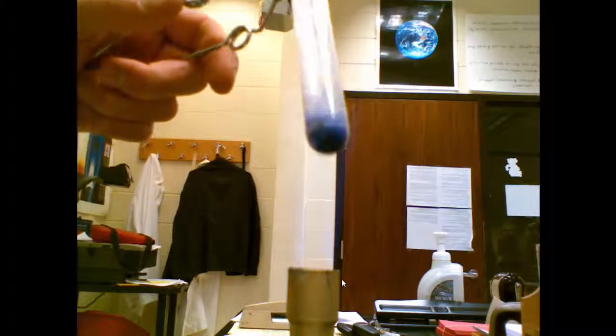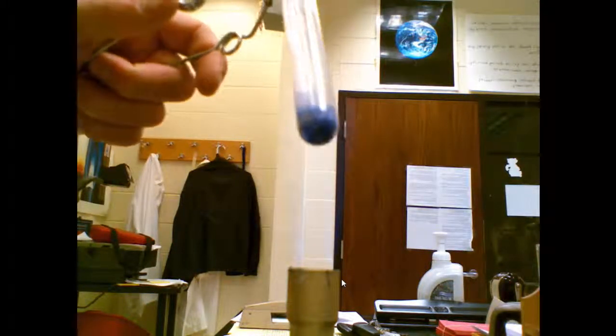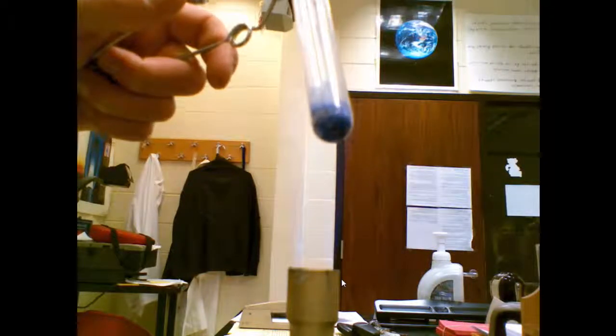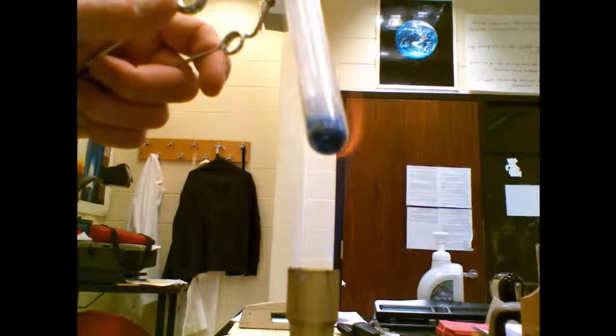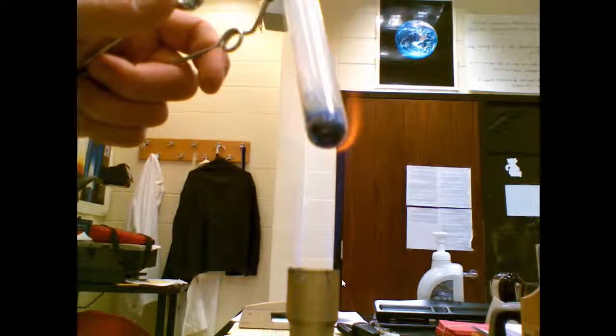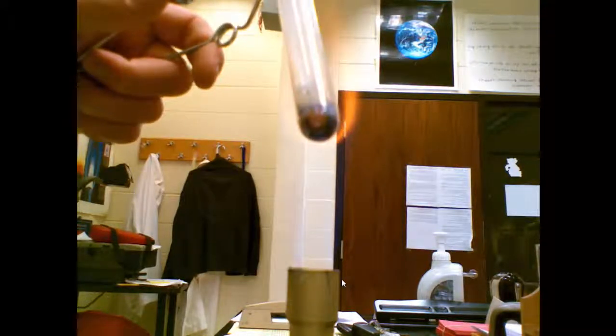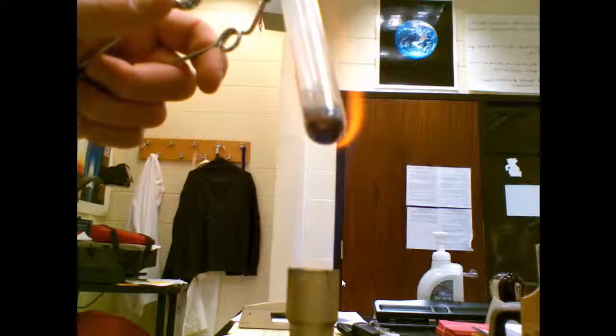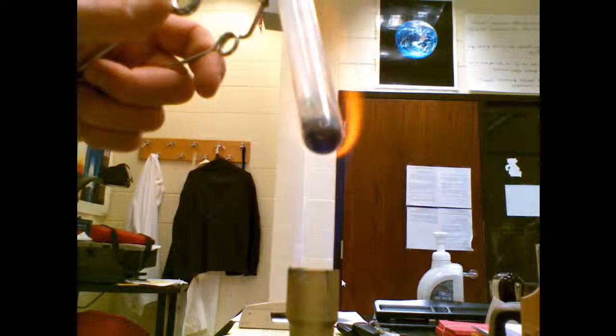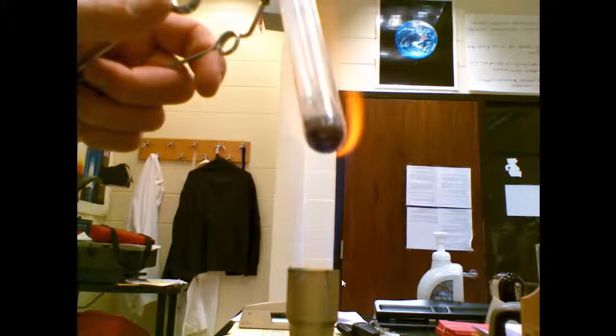Sample 11, a blue granular solid. So it's been in the flame for a little bit. The flame is just beginning to turn yellow. It's sitting in the flame for a while. The flame is very yellow and the crystal has not began to melt.